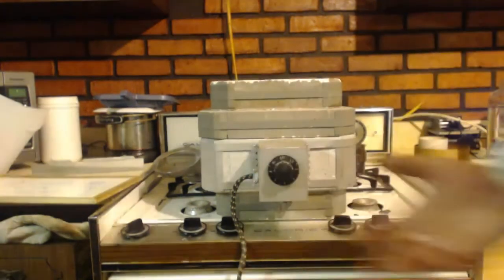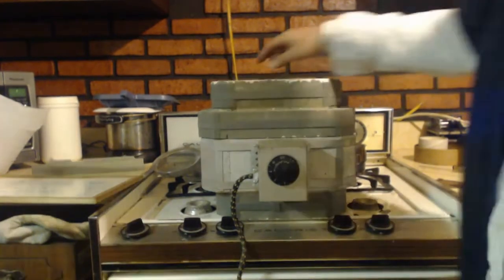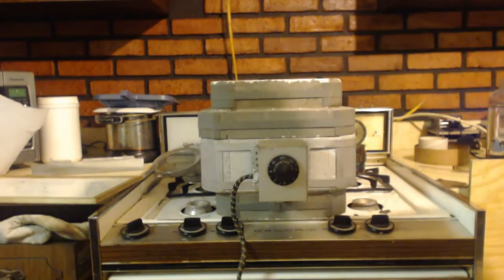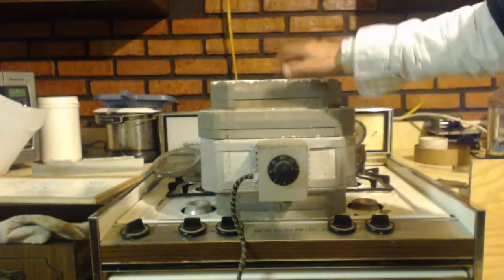Do I want to sit there forever holding that crap, and both the torches and that? No. So I got my kiln out, but I did show that it is possible to do it with that. It just takes forever. So if you got a foundry or you got a kiln, that's the best bet.